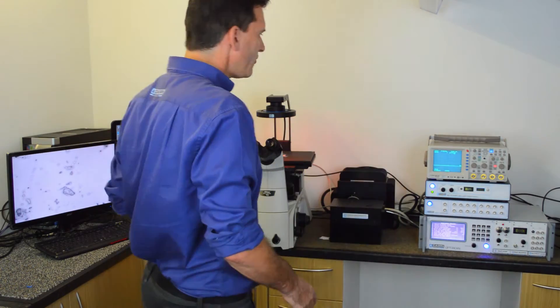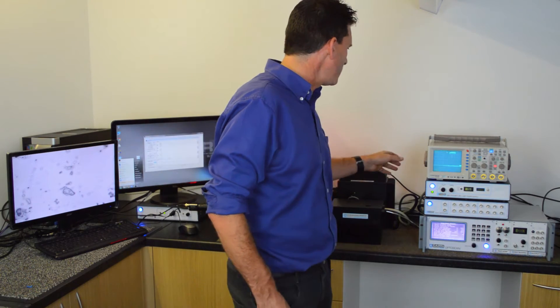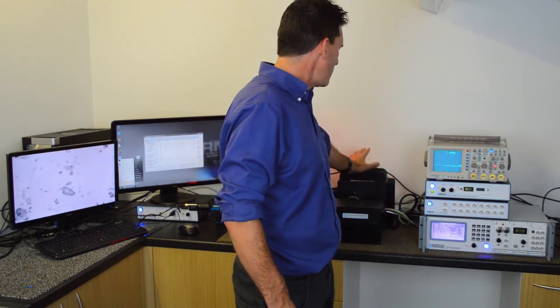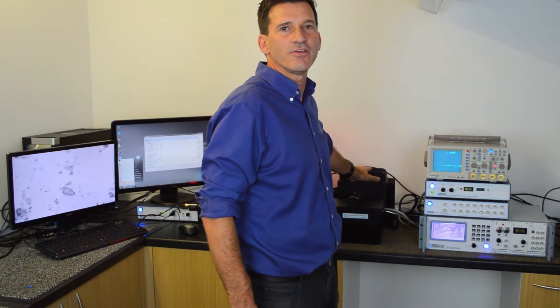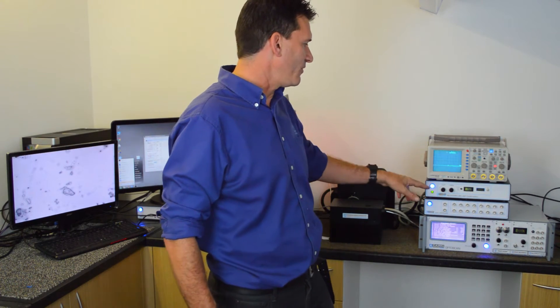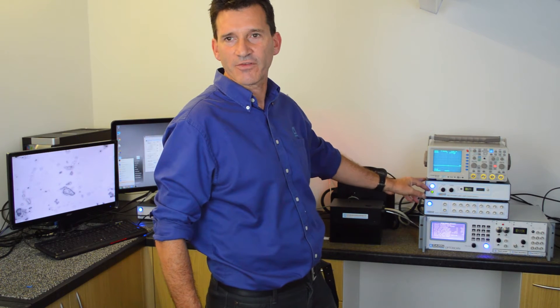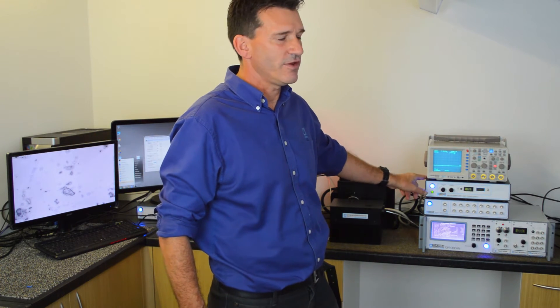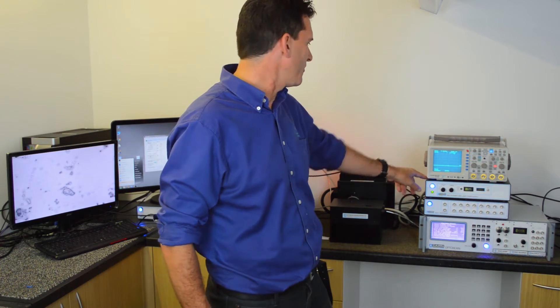This is an overview of the system. Starting in order of where the photons come from, they're generated by a high-intensity xenon arc lamp — in this instance the 75-watt OptoSource — to give us the combination of intensity and stability that we want for looking at sensitive optical measurements.